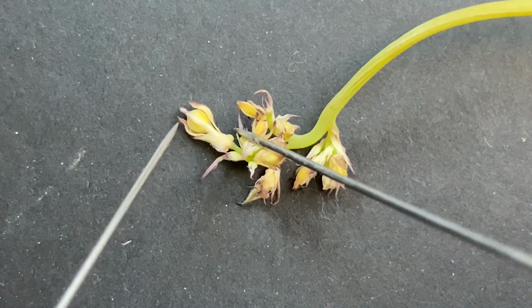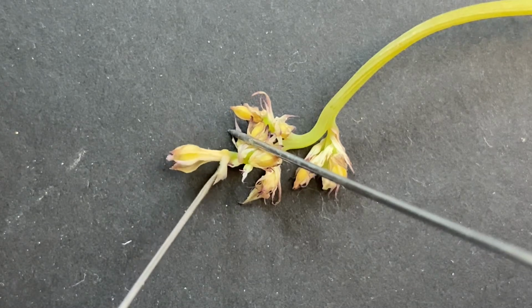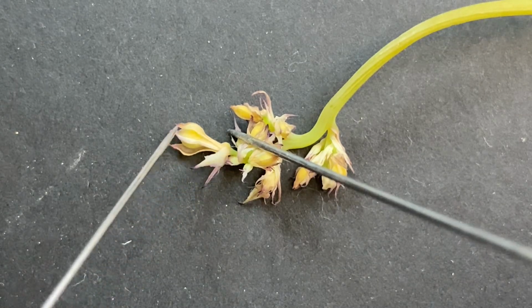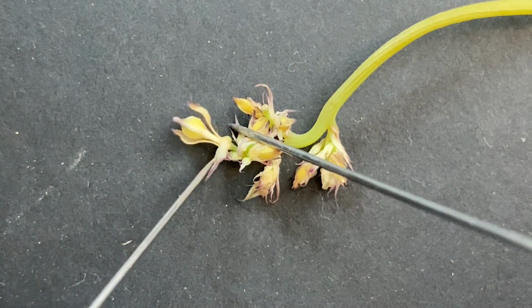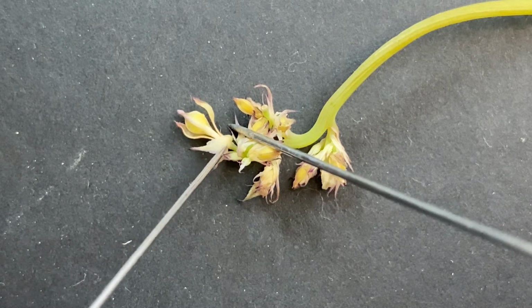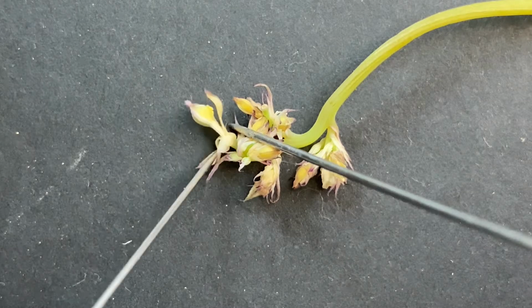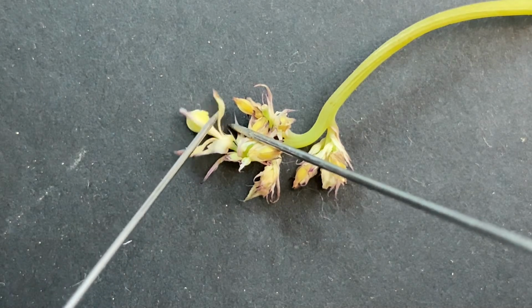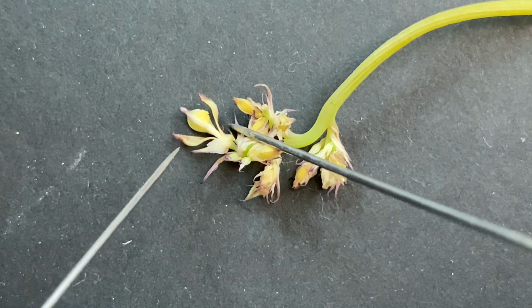Oh wow, and so in this one, you're actually seeing a lot more. So right here at the base, you can see this sepal, and then it's even starting to separate right here. Sorry, I think I called that the wrong thing because I started looking ahead. Down here at the base is the bract, and then on either side of the corolla are these two fused sepals.